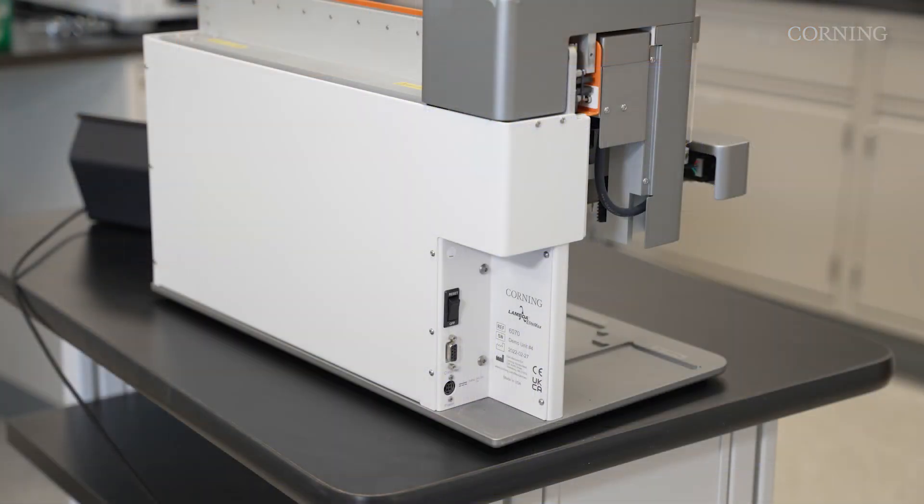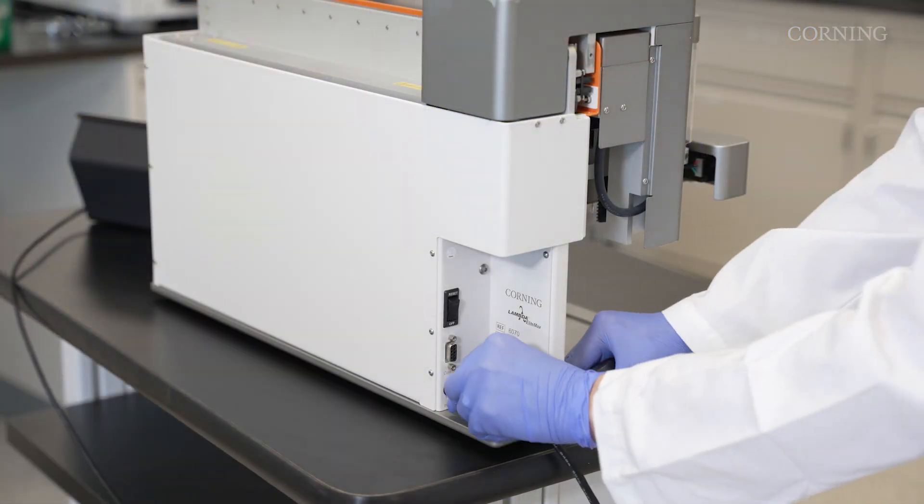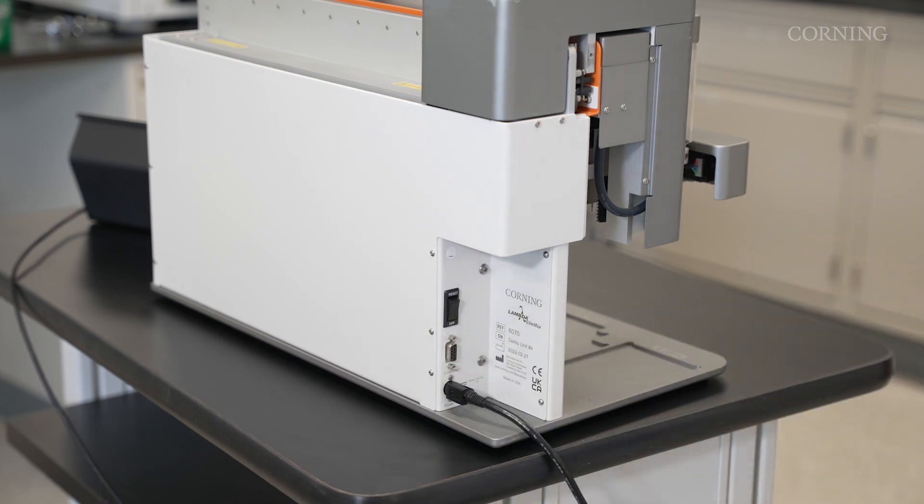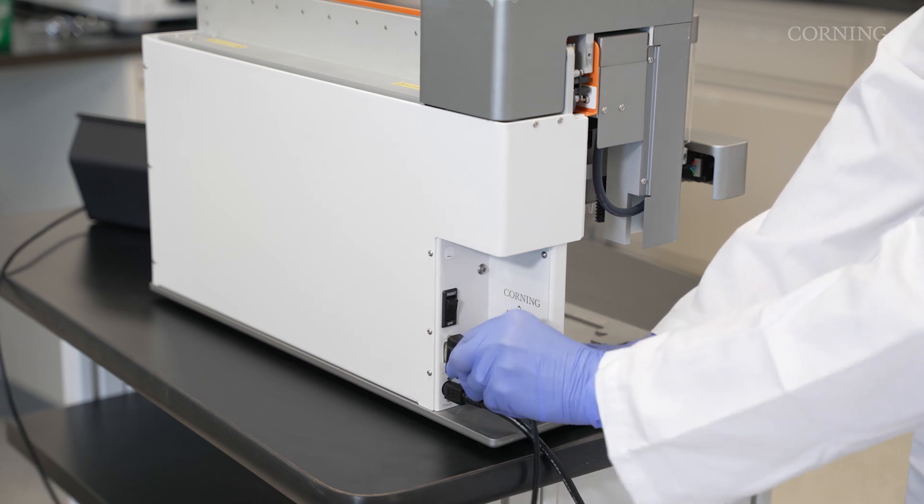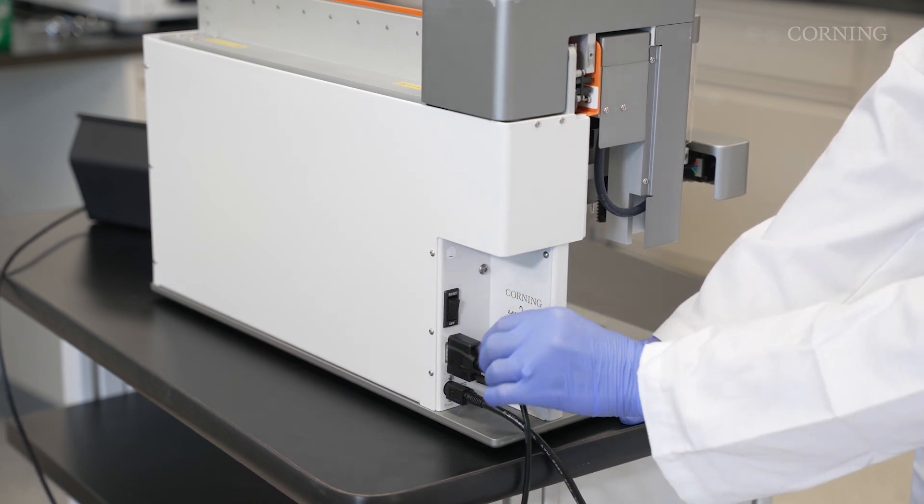Starting with installation. 1. Plug the power supply into the base unit. 2. Connect the power cord to the power supply, then plug the power cord into the outlet. 3. Plug the touchscreen controller's VGA cord into the base unit.